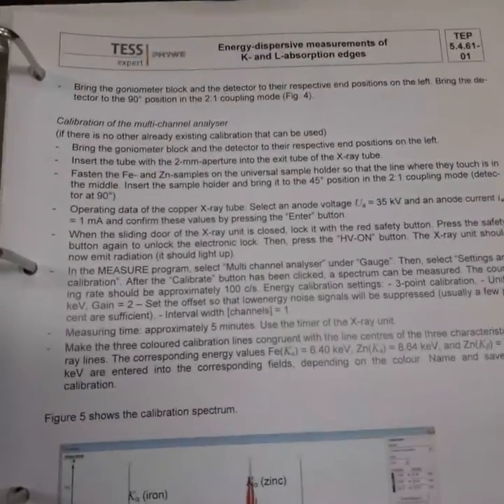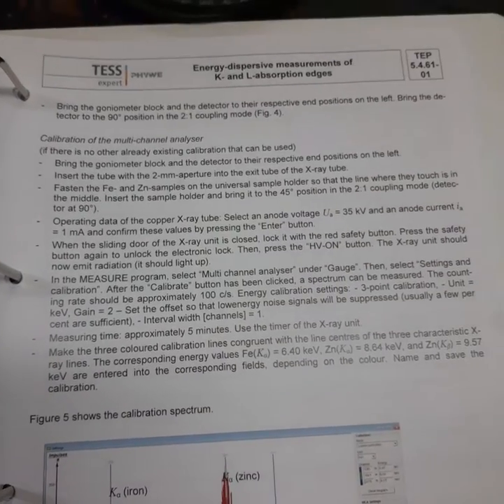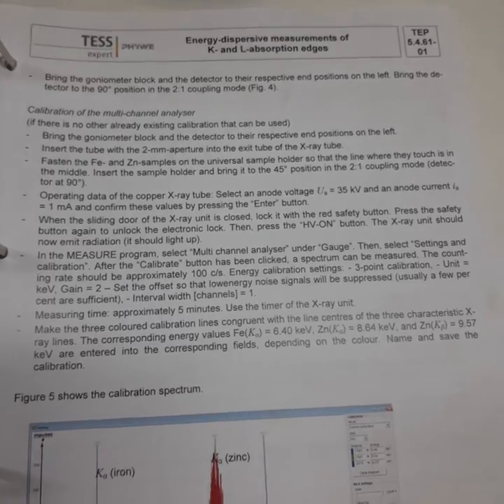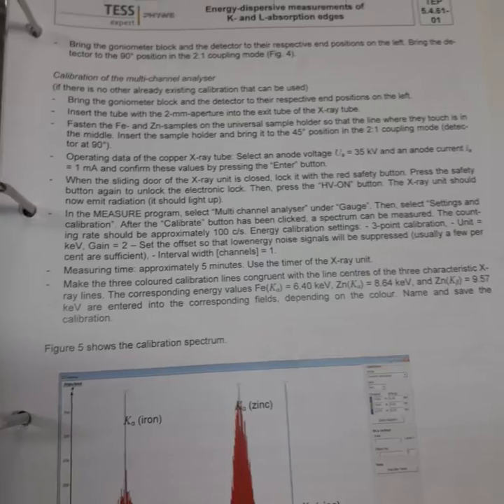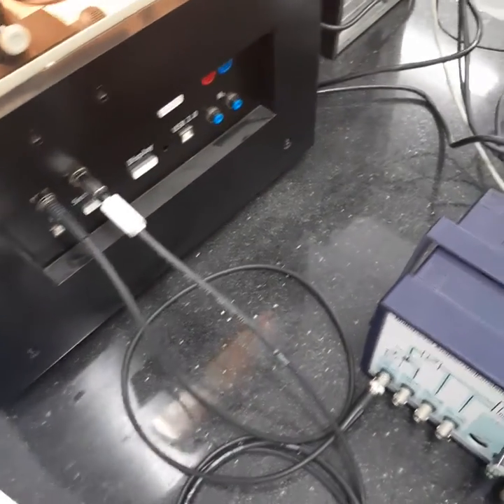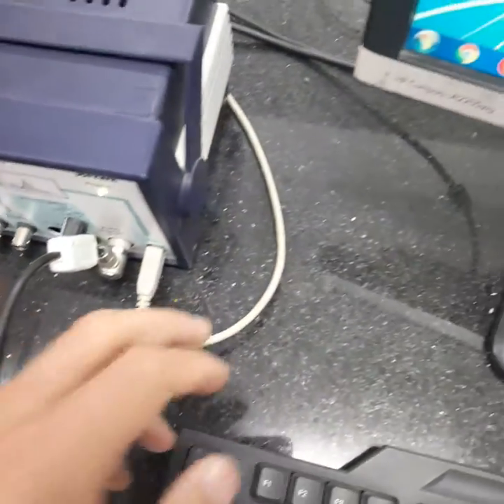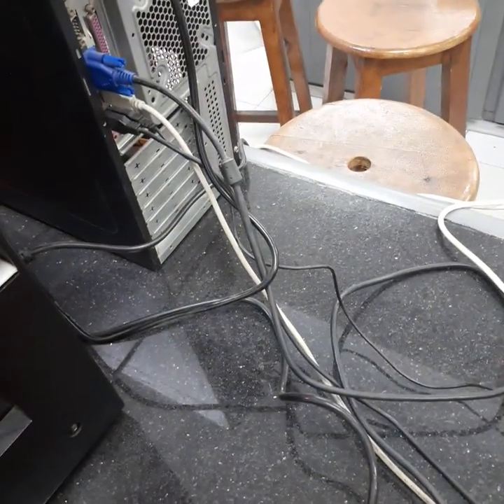We have returned back to our experiment named energy-dispersive measurements of K and L absorption edges. Now we would like to retest the experiment using the instructions sent to us by the company. As you can see here, there is no connection between the XRD and the computer. All the connections exist between the multi-channel analyzer and the computer, as you can see here.